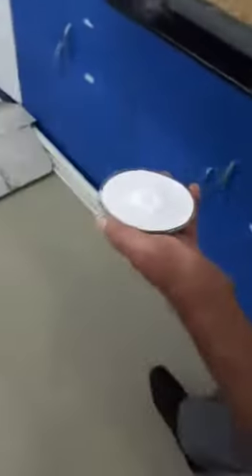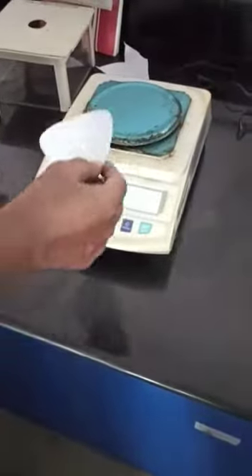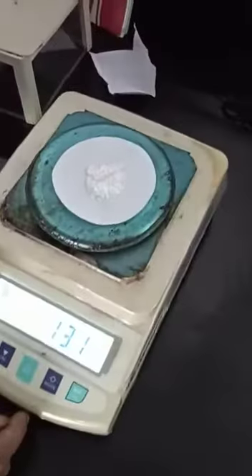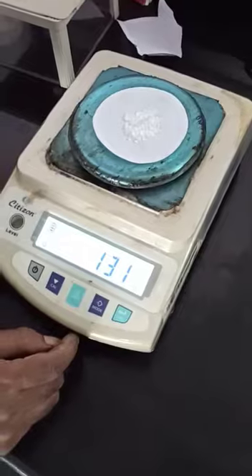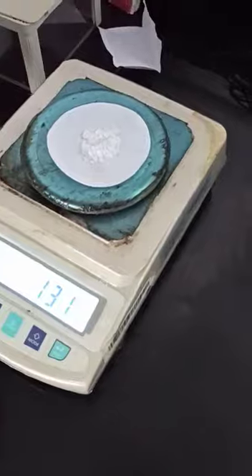We will weigh this aspirin the same way as we have done previously. We have to switch on the instrument, then place the filter paper with the compound. We will note how much compound with the filter paper we got, and we will store this compound in our storage bottle.